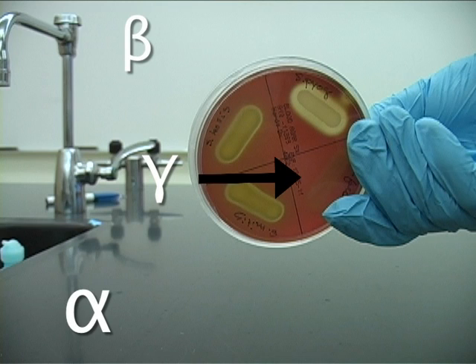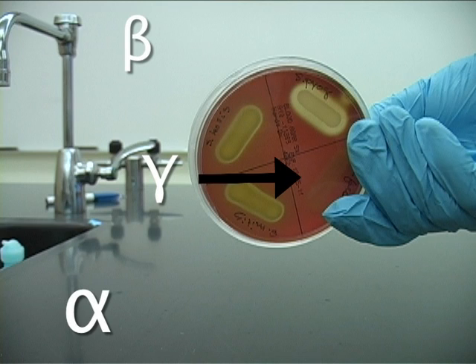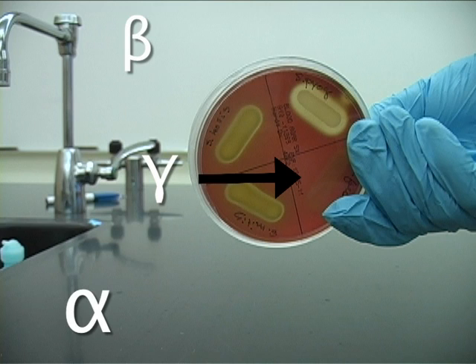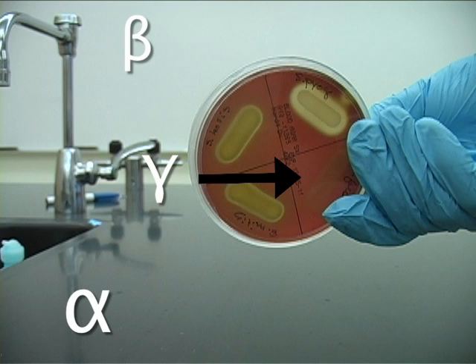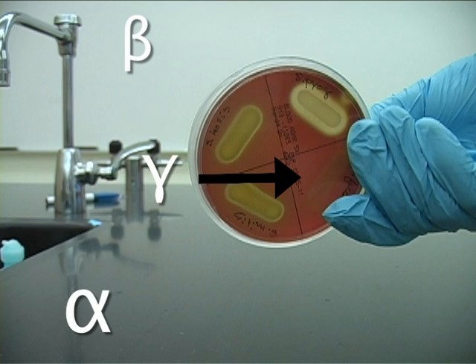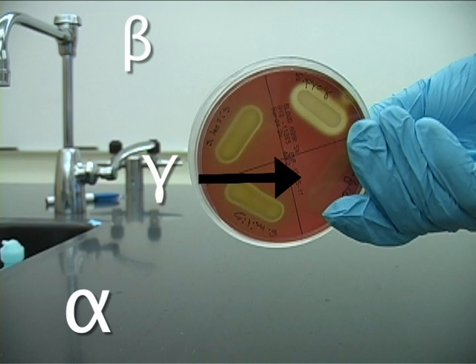Gamma hemolysis is actually a misnomer. There's no lysis happening at all, so the media should be unchanged. Make sure to look at the bottom, not the top, because the bacteria might have its own color, which might be confusing.